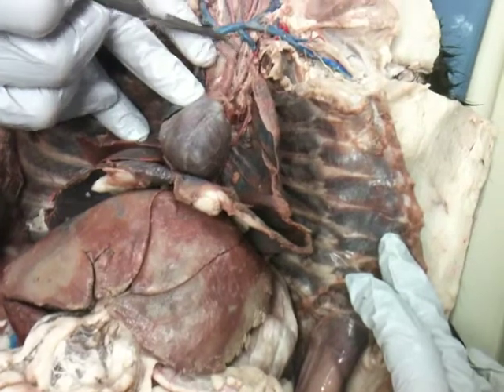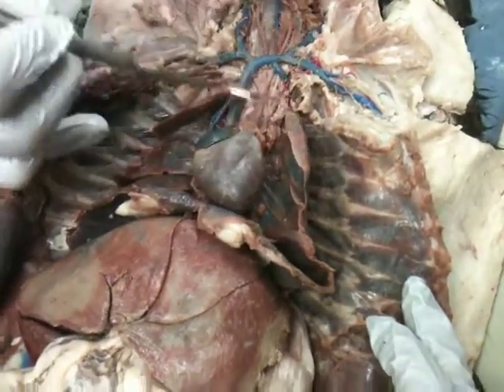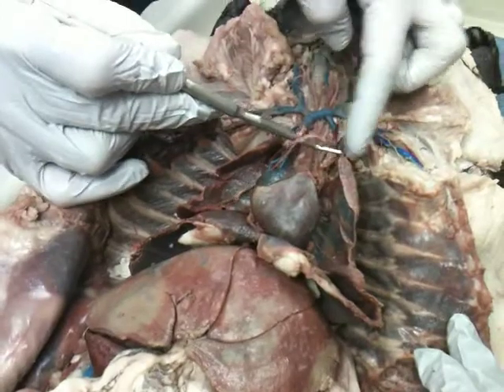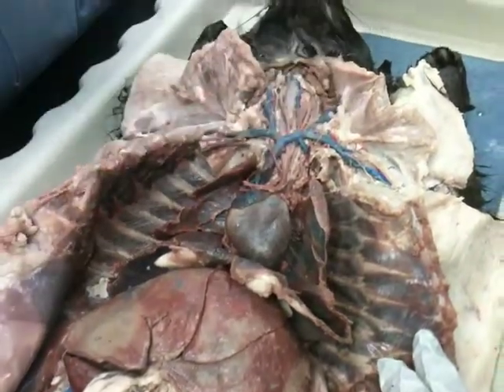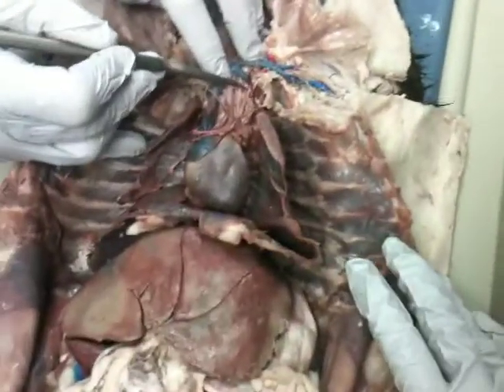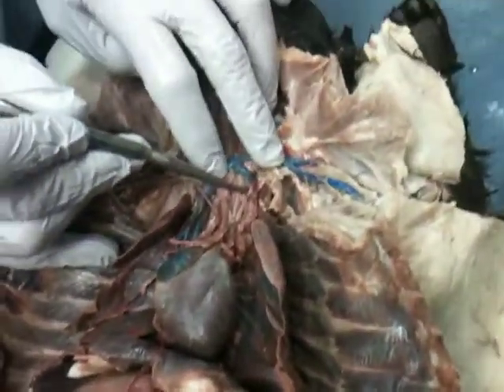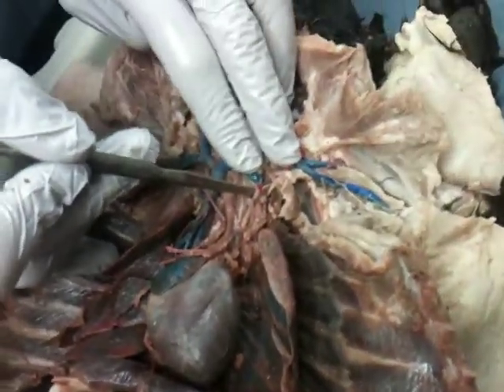Good. One of the first branches, we have the internal mammary artery, and that's this one over here. So this has a really good internal mammaries, both of these guys. And then there's another little artery that goes off from the back side, from the posterior of the subclavian. This little guy, it's hard to tell because this one has been broken off also. Here's your vertebral, that little guy going off a little bit more posterior.